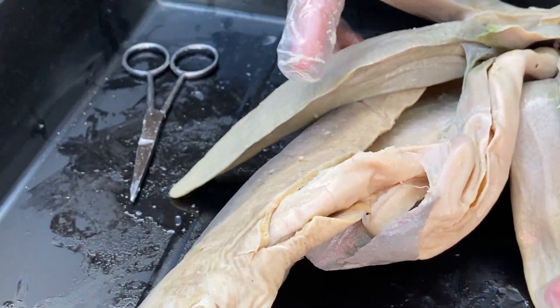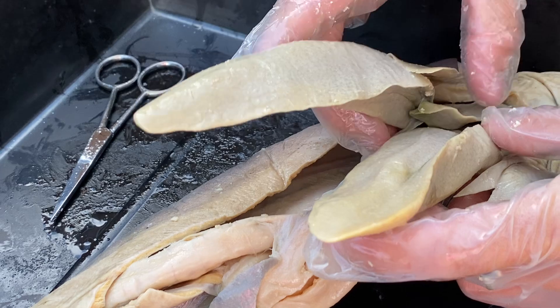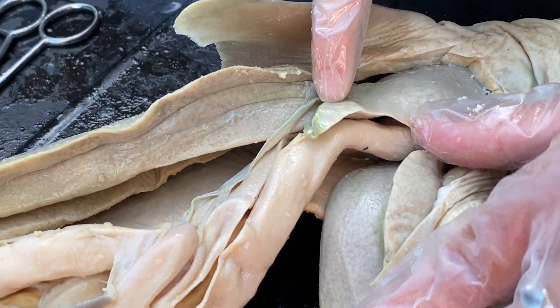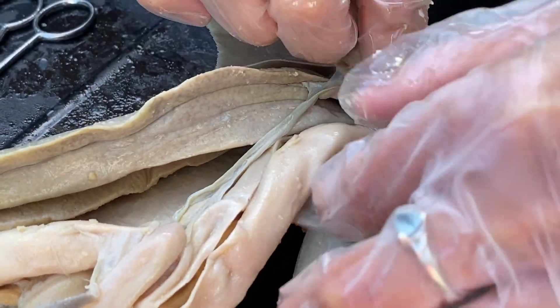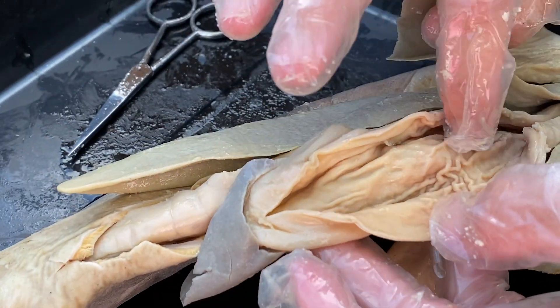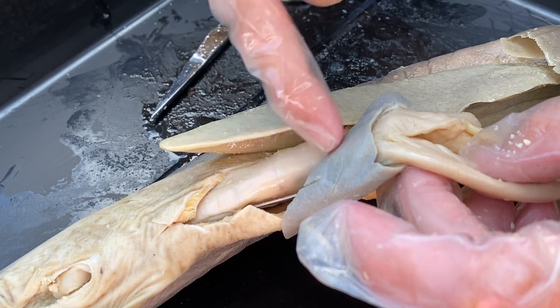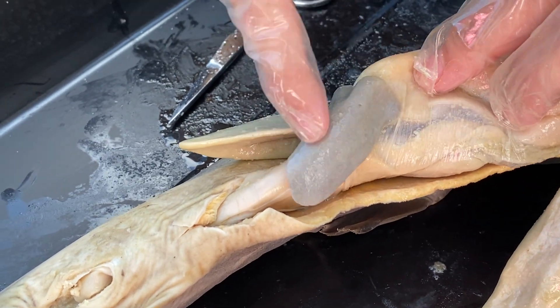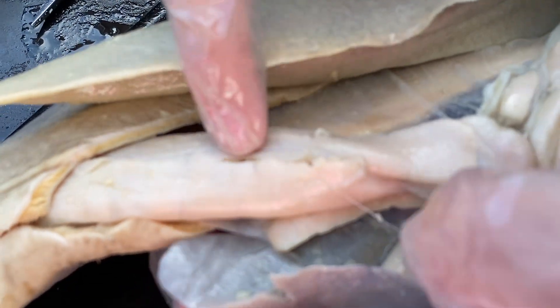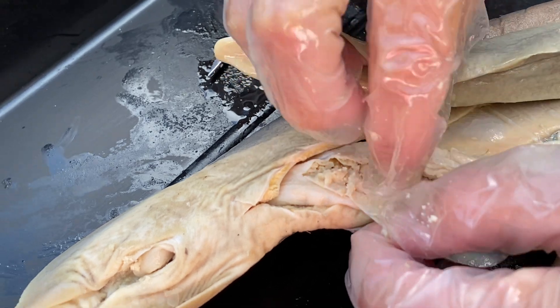To recap the big structures: you have your livers, producing bile and lots of oil, helping the digestive system. You have your gallbladder, which stores the bile produced by the liver. You have your esophagus, which has these little papillae. You have the stomach, which has your rugae, which increases your surface area for absorption. You have the spleen, producing red blood cells and also helping with digestion. You have your pancreas with digestion as well. And you have your spiral valve, which is going to increase surface area for final absorption of nutrients.